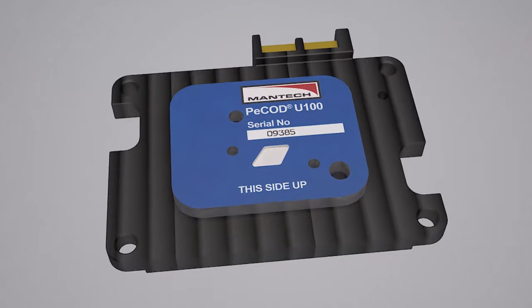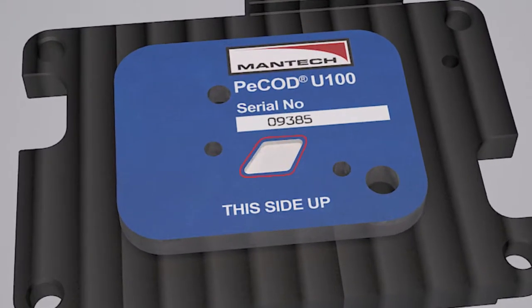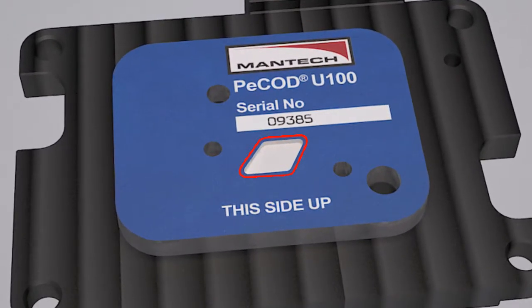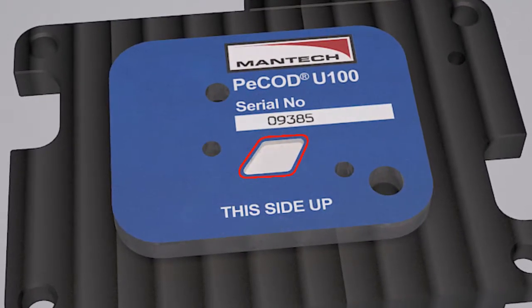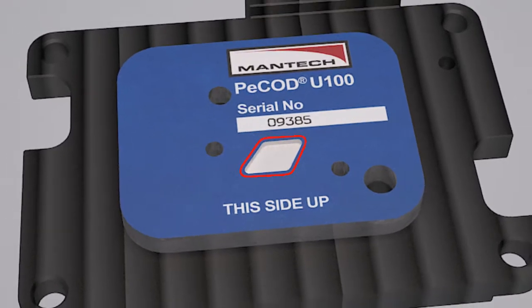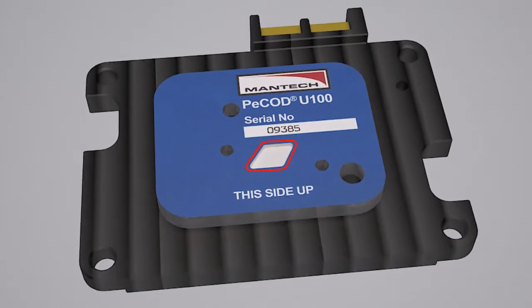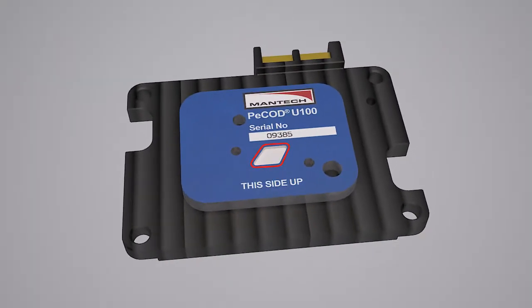A key advantage of PCOD technology is that it does not use mercury to remove chloride from a sample. A safe and stable silver nitrate doping agent is used to remove chloride interference.